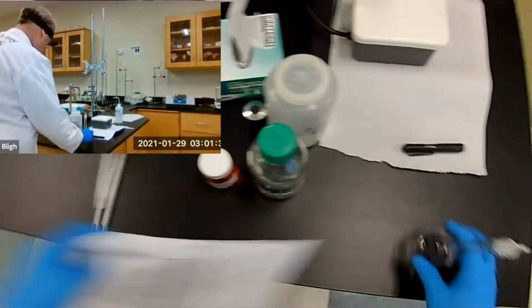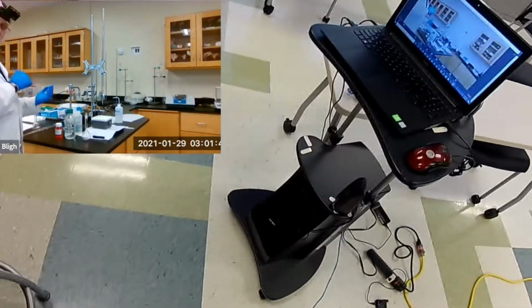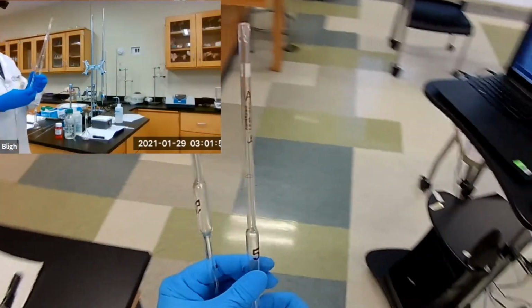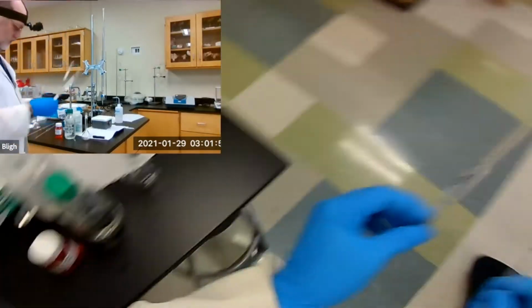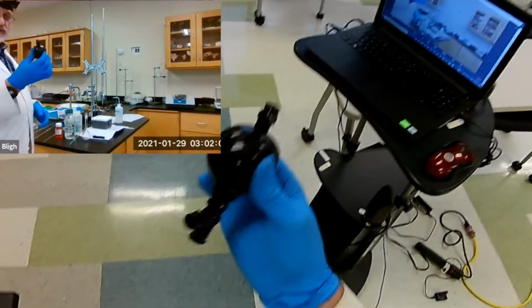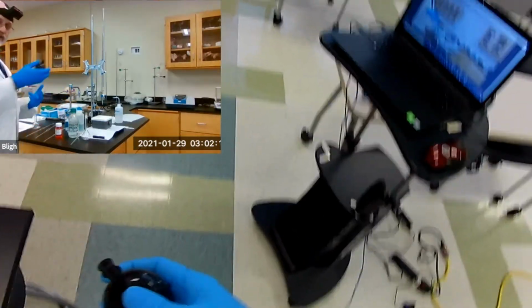Okay, we got that. We need a way to measure out each one of these. And there's going to be 5 milliliters of each one, but we don't want to cross-contaminate. So we have two 5 milliliter volumetric pipettes, one for each. And we also have a pipette bulb, and you're familiar with this item, so I don't have to explain how to use it. We've used it several times before, both in Gen Chem 1 and in a previous lab in this course.